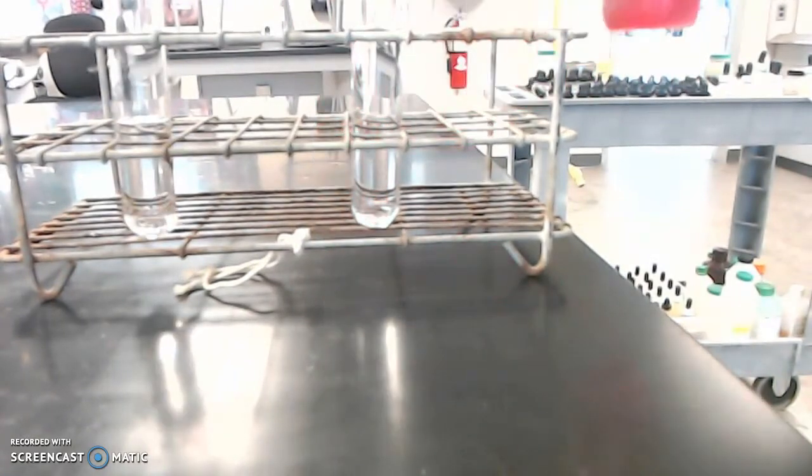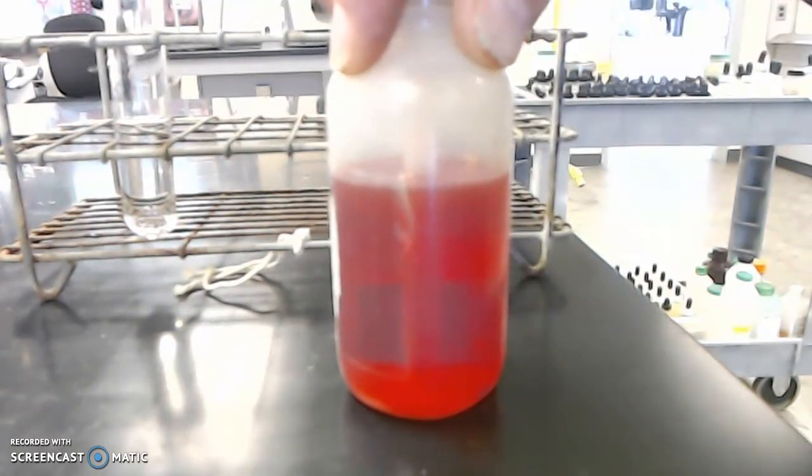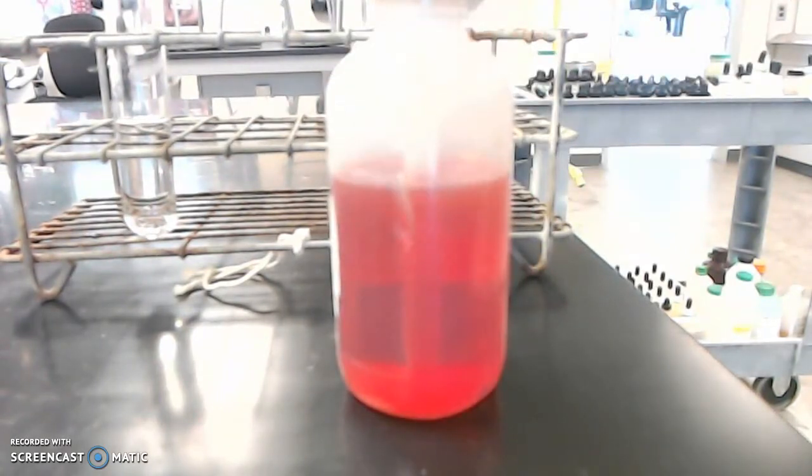And phenol red. There it is right there in a bottle. It kind of looks like Kool-Aid, but it ain't Kool-Aid. Don't consider this to be Kool-Aid. It is an indicator. It is a chemical which will change colors depending on how acidic a solution is. So phenol red is called an indicator. The lab part of this is just putting some phenol red in the acid, and then also into the water, and seeing if we get any changes. So you've got your properties listed.